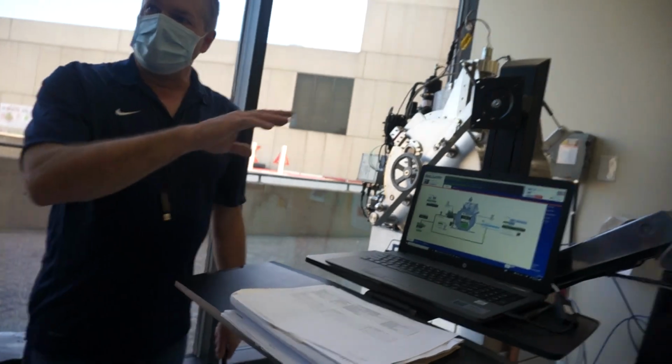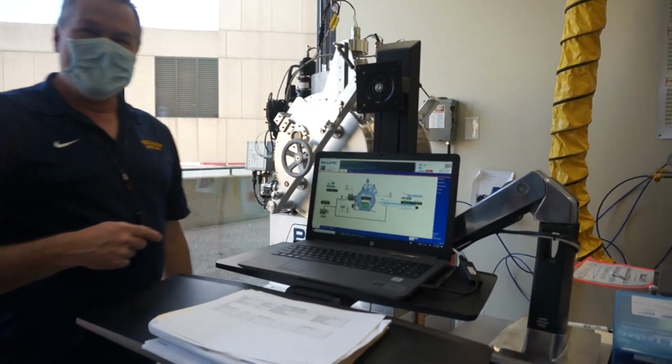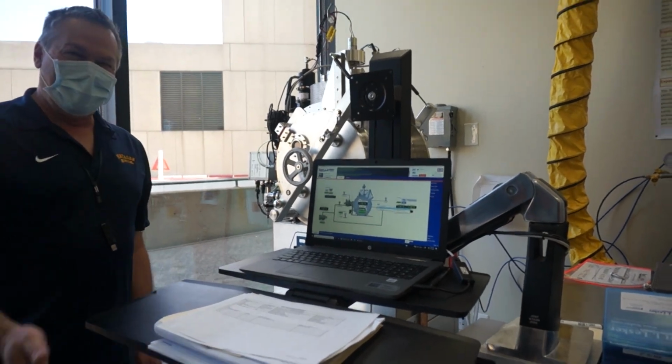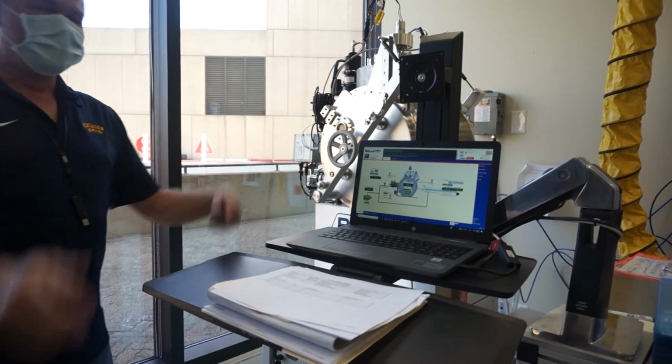So I kept making this mistake yesterday. The majority of our tools are touch screens, except the Nano. This is just a laptop. That's awesome. I'll be counting how many times you try to touch it. Yeah, she's actually keeping tally. I'm like, why won't this work? I'm like, oh, wait a minute.